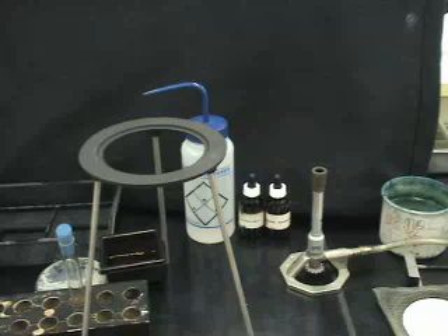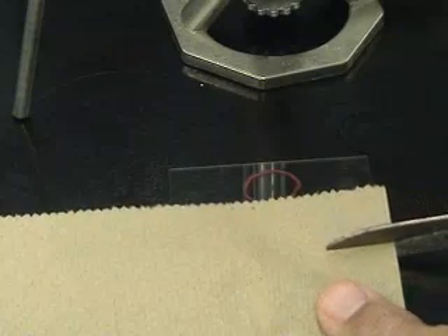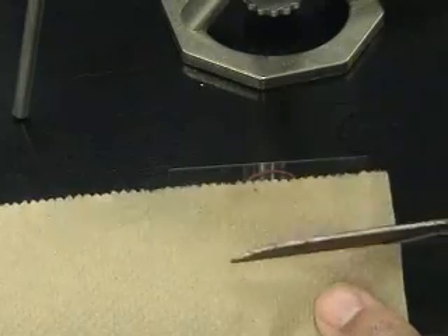In this video, we are going to demonstrate the endospore stain. To do an endospore stain, a smear is first prepared as outlined in smear preparation.